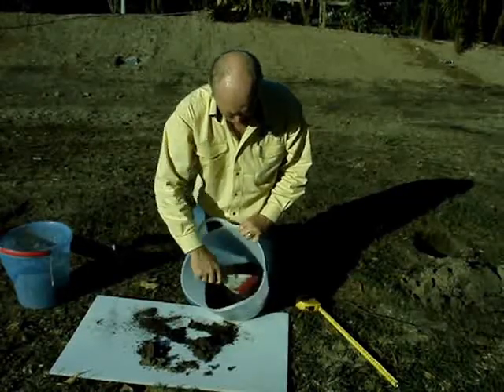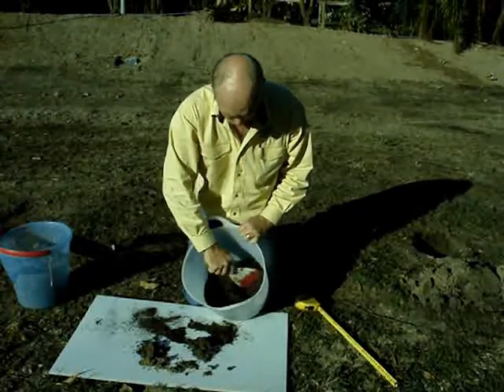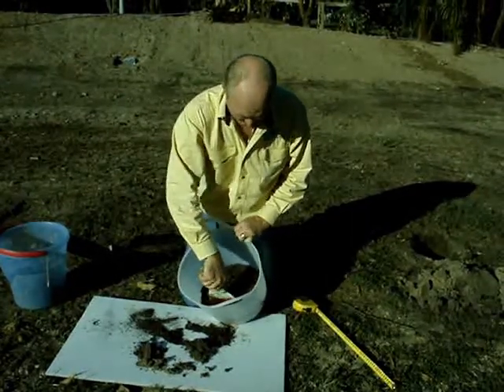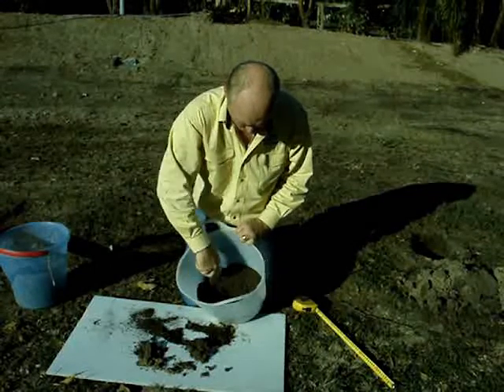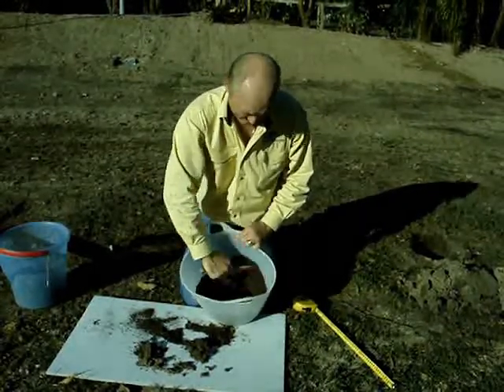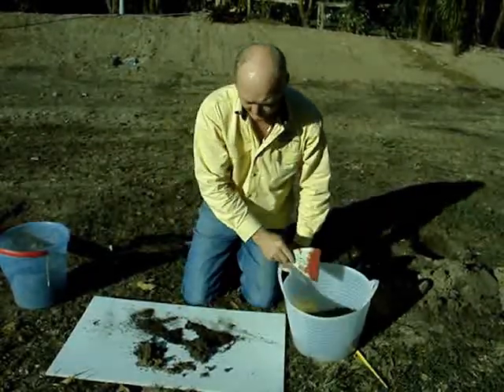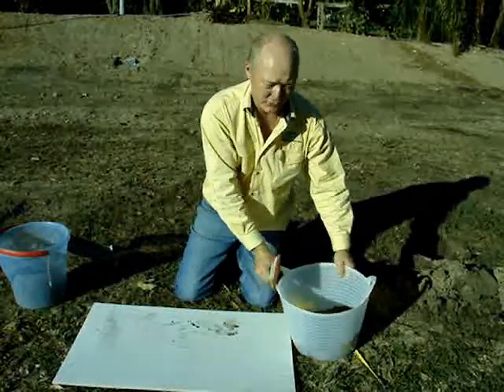The actual samples are all really well mixed up. We're going to sub-sample, which means we chop it up, stir it up, and get it all mixed up nice and even.